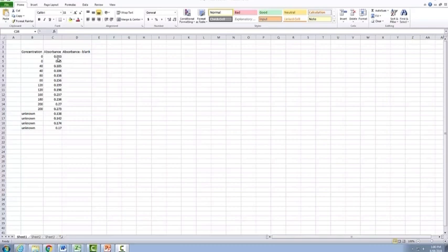So the first way that you could use is you could actually calculate the average of these two tubes yourself, either by a calculator or using Excel itself, and then you can actually input in the formula here with equals, because that always tells Excel that you're starting a formula, and then you want to subtract your average blank, so it will be C4 subtract 0.0515 is the average. So therefore then you press enter, and that then gives you obviously a slight absorbance reading because the average between these two is not going to give you straight 0.